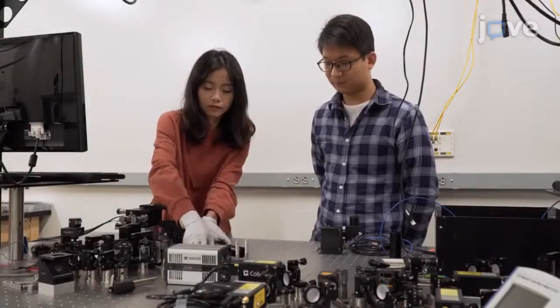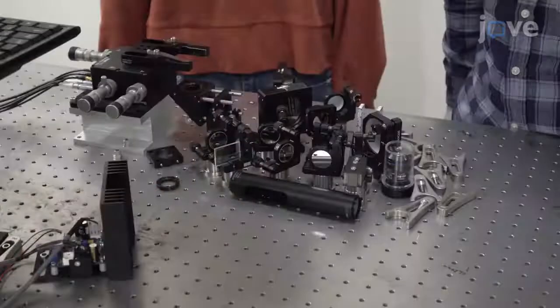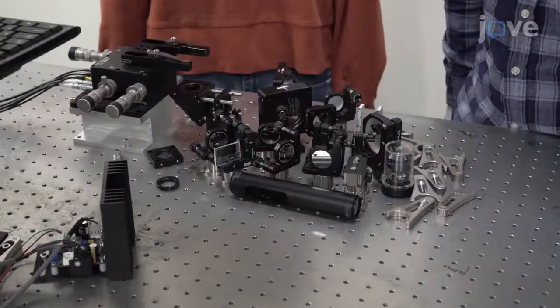After gathering the necessary components, start building the system. Here, several elements are already in position on the bench.